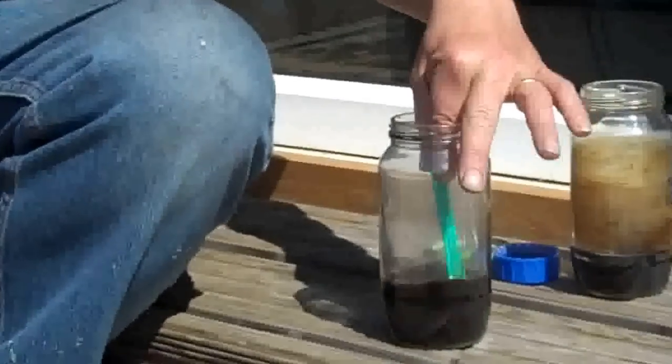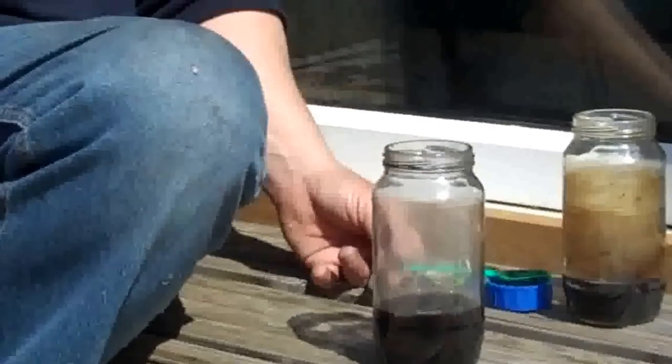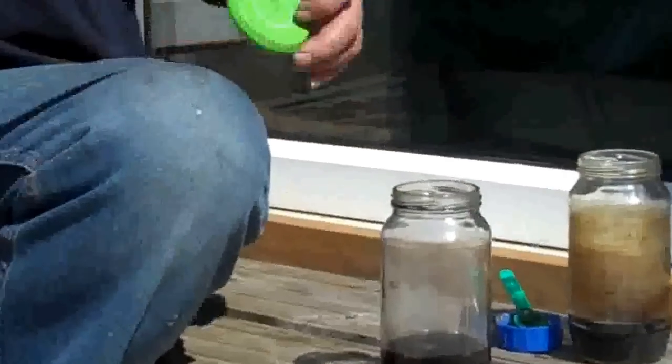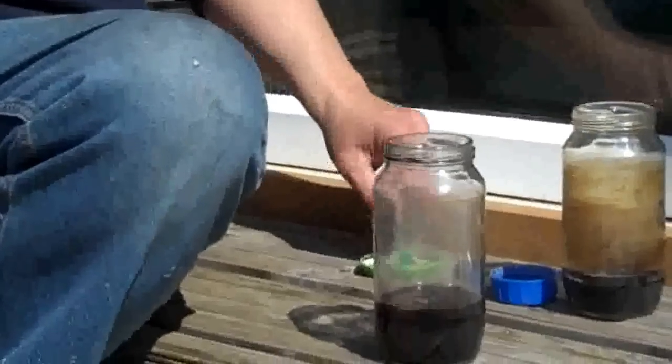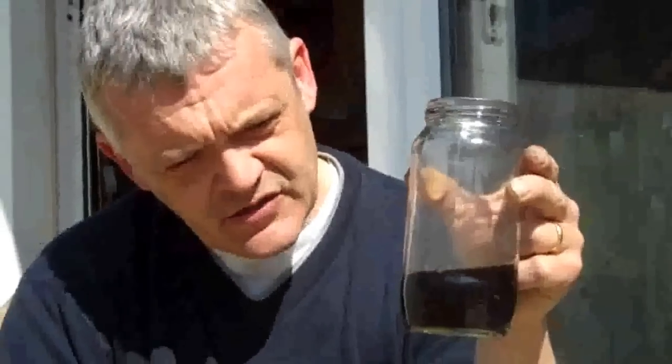You'll see what's happened there. Iron-3-chloride, when added to water, gives a bright red solution. And this one is black. The reason this one is black is the tea has almost immediately reduced the iron-salt to zero-valent iron. So what's in there is zero-valent iron nanoparticles surrounded by tea.